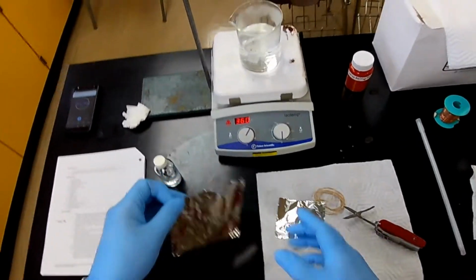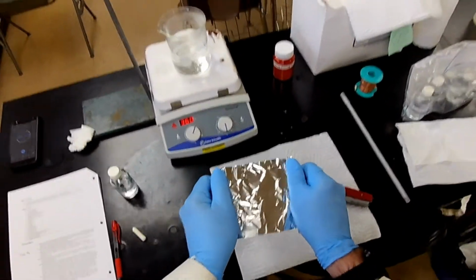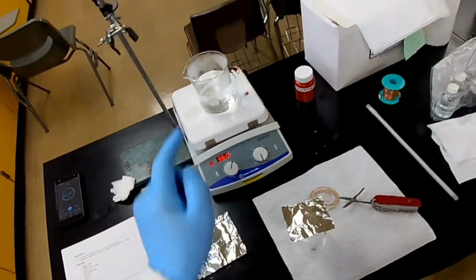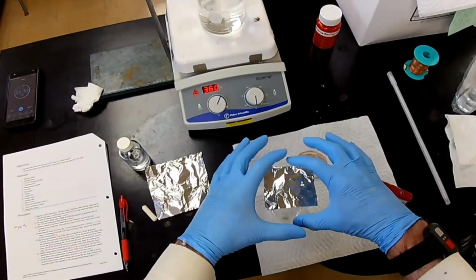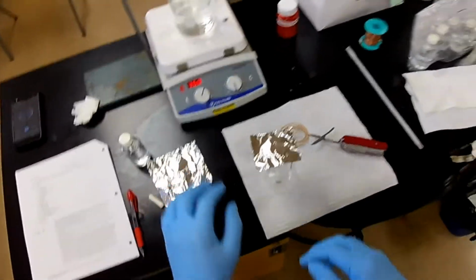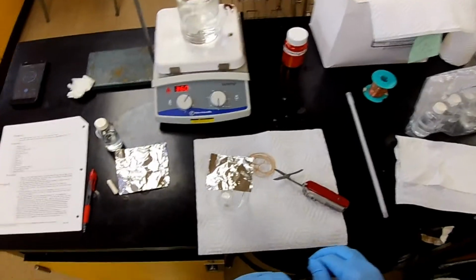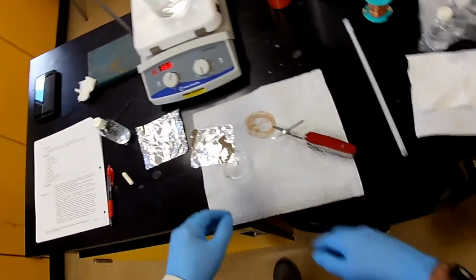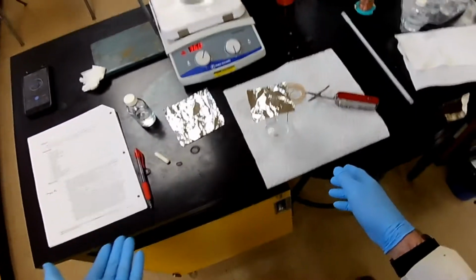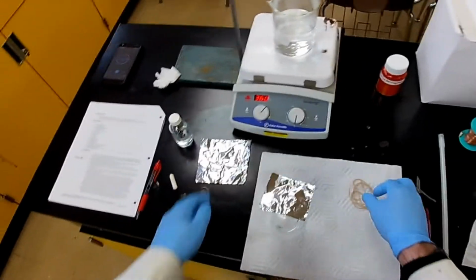But we use this larger piece because once we get that small piece covered, we're going to cover it completely with the big one. Why? Because in a boiling water bath, you got water vapor coming up there. And if we completely protect this lid with that one, then we can keep condensation to a minimum around this inner piece. And when we take that one off, which we do not weigh, then all we have to do is dab the drops to be sure that we have removed all the moisture. We're going to use rubber bands to hold the big one on there.